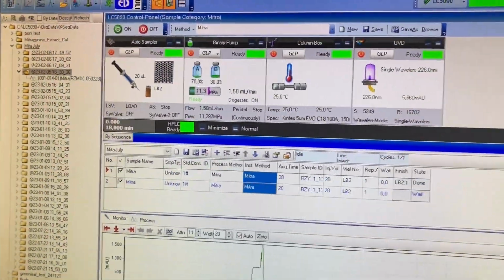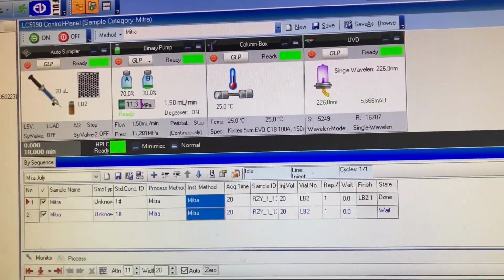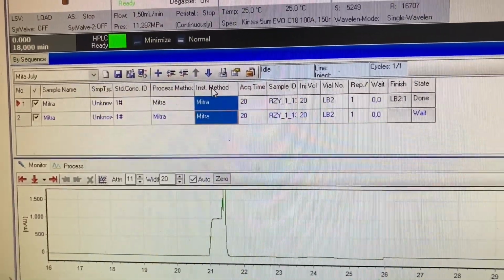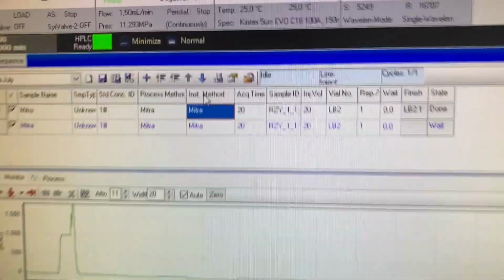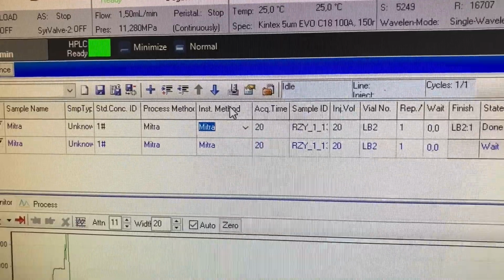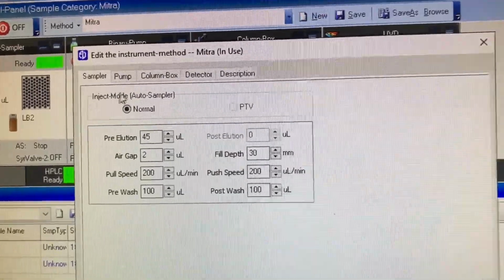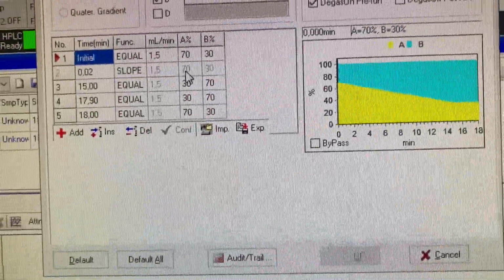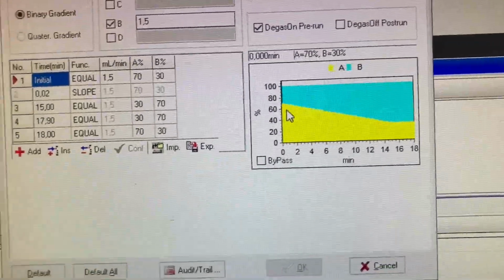So I'll just quickly go over the settings. This is for testing mitragynine. If you want to see the method, come down and click, it says instrument method there, click on there and double click. So there's the settings for the sampler, the pump. You can see a nice slope on there. If it looks like that, it's probably correct.